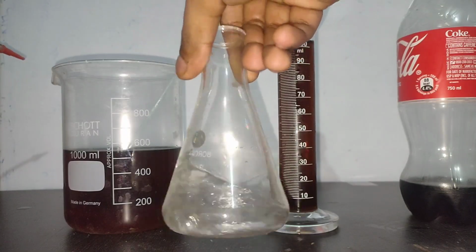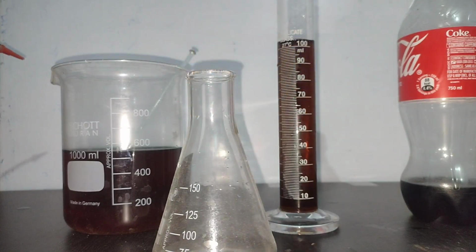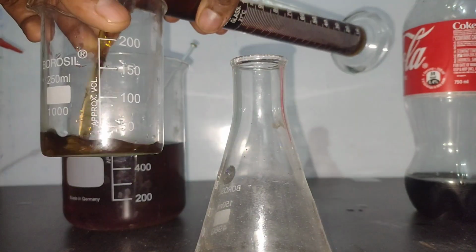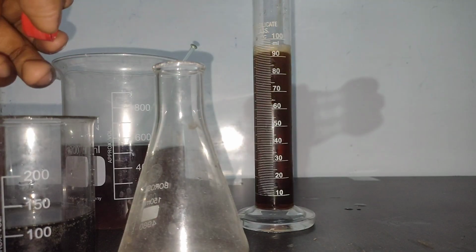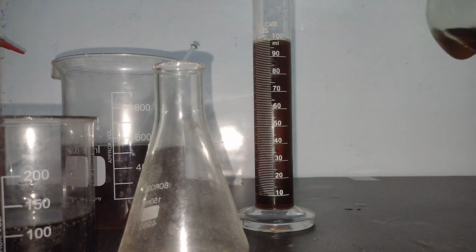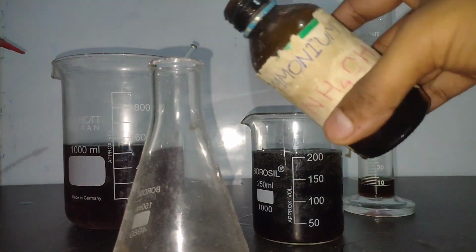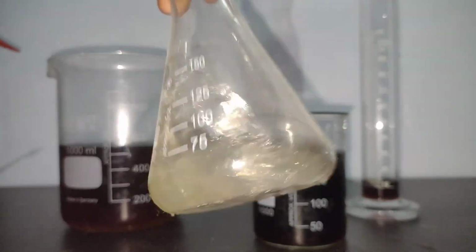So now I will be relying on a different method, which is the magnesium ammonium phosphate precipitation method. For that I dissolved some magnesium sulfate and ammonium chloride in some distilled water and took out 200 ml of Coca-Cola in another beaker. After the ammonium chloride and magnesium sulfate had been dissolved, to the solution I added some ammonium hydroxide, and you can see that no precipitation has occurred.